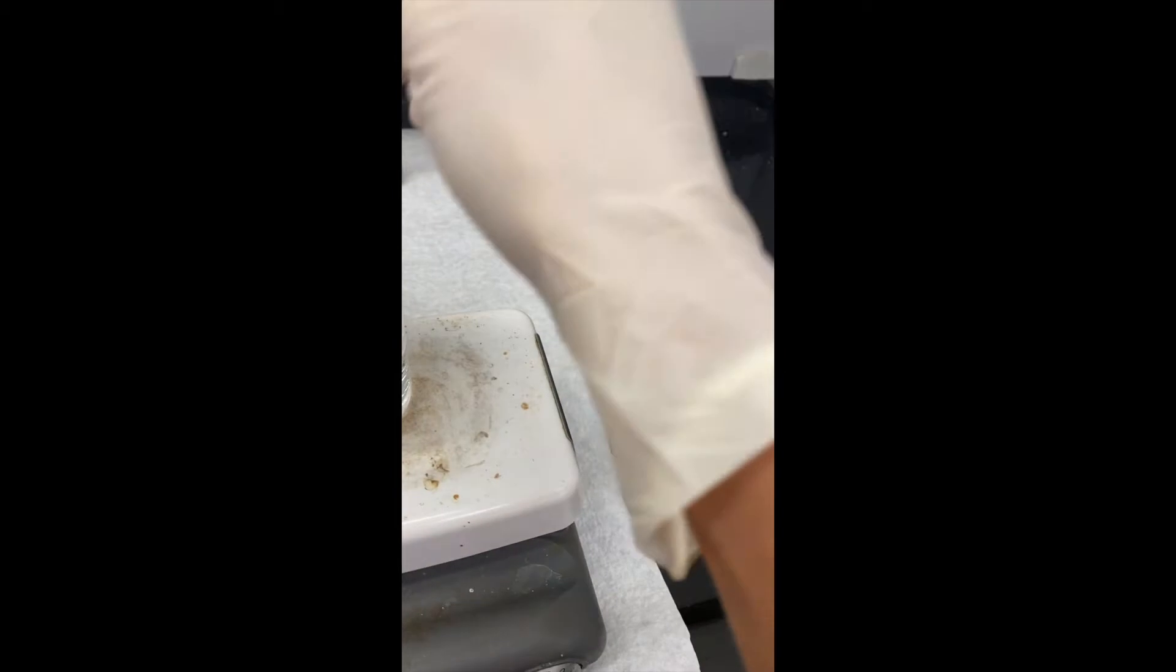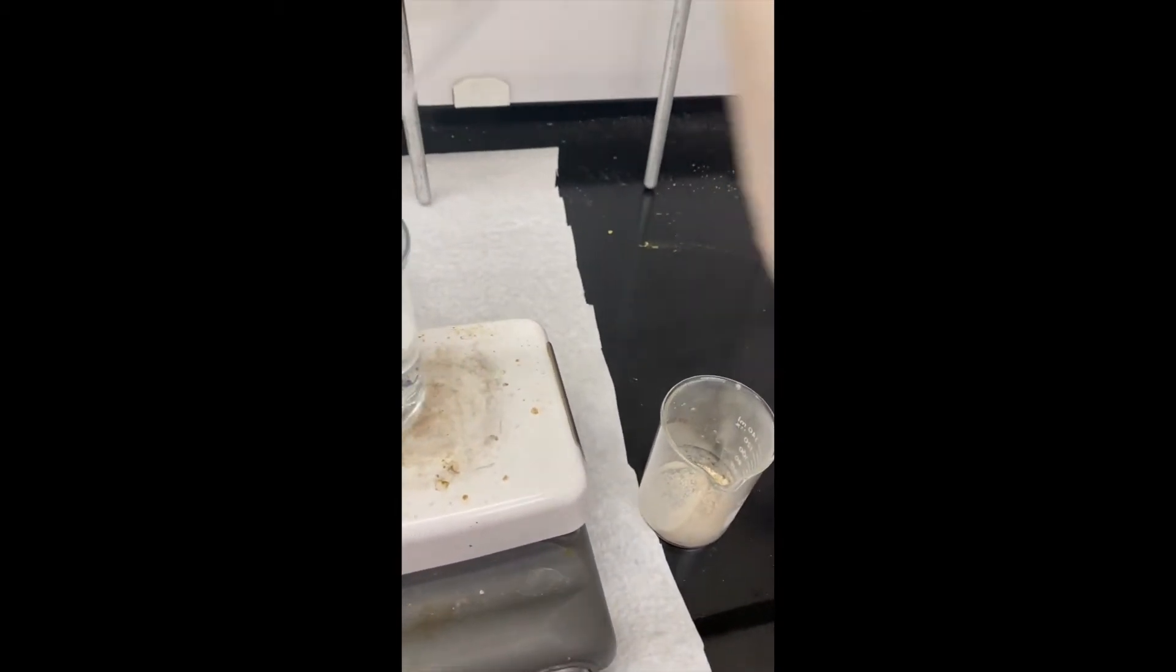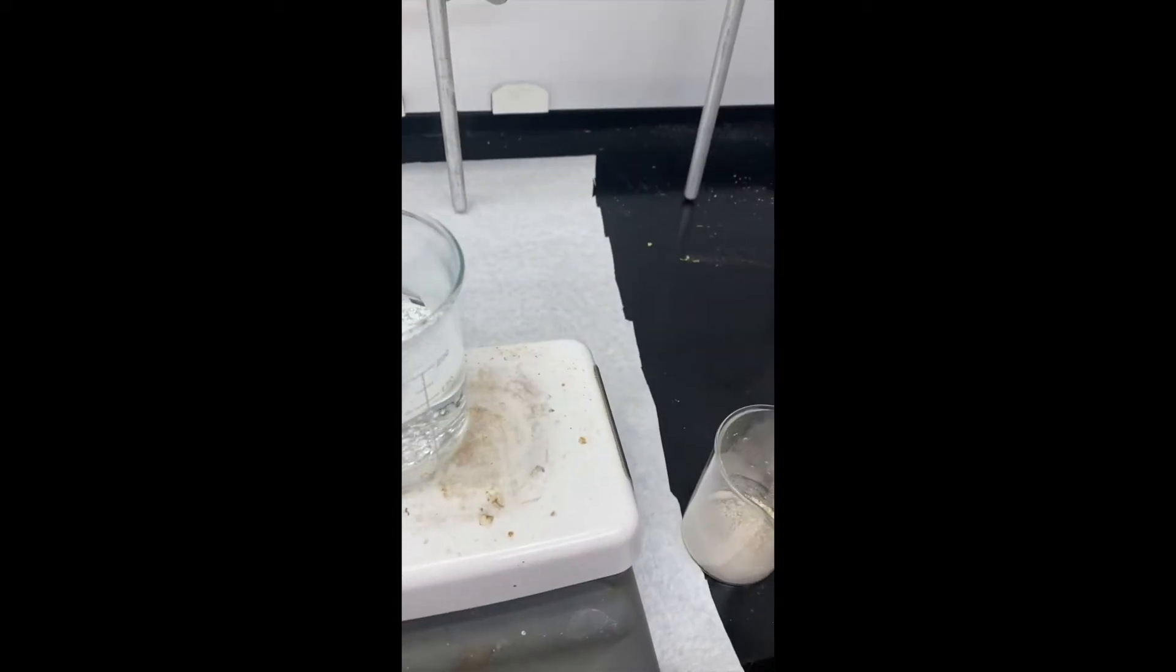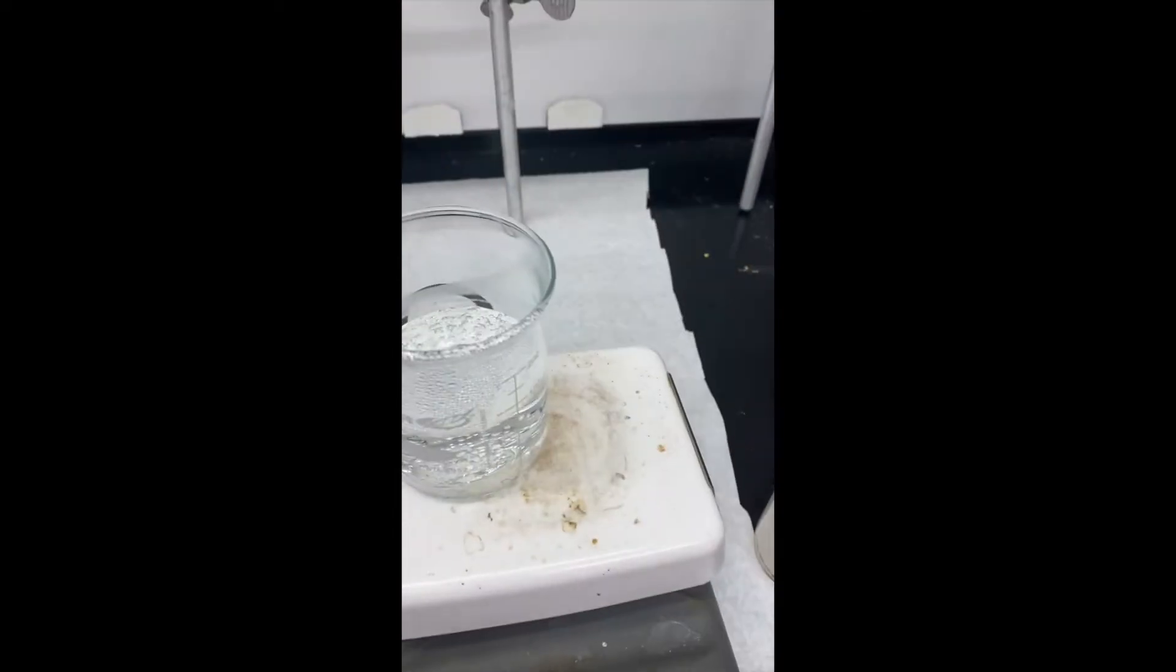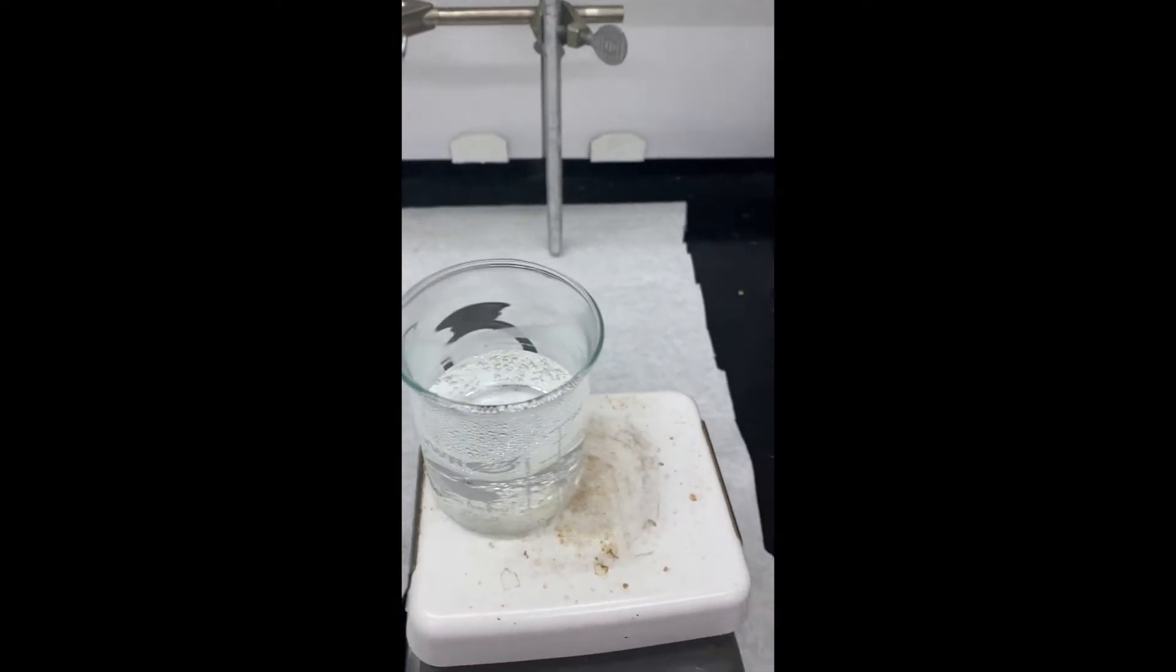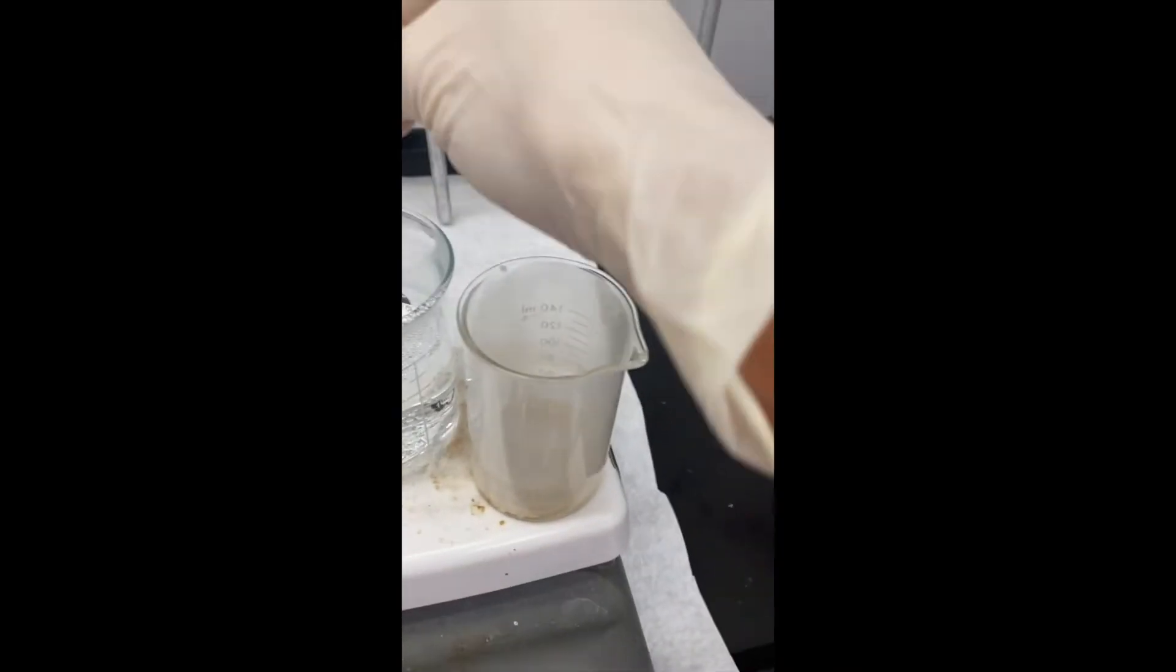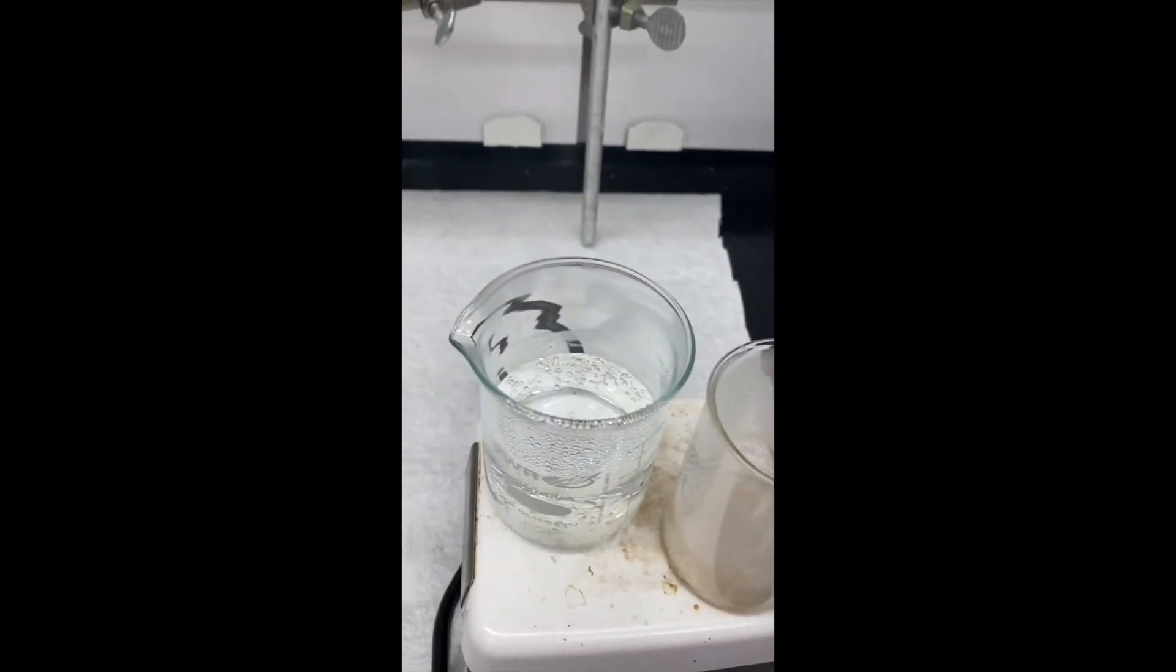The first thing you need to do is boil some of your solvent and get that piping hot. And I'm just going to add a few pipette drops of my solvent to my solid. In this case, this is our unknown. And then I want to keep that solvent hot, so I'm just going to transfer it and put that right on the hot plate as well.